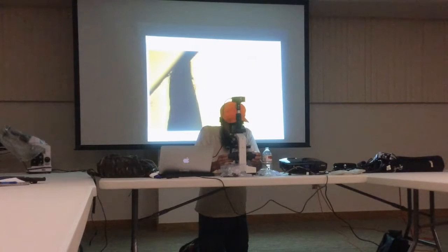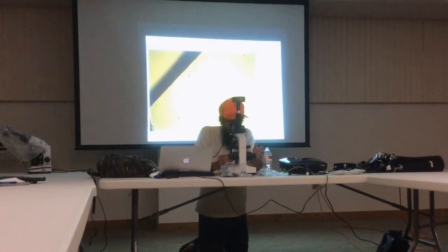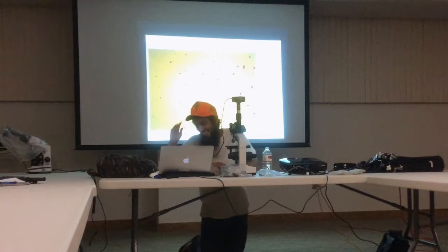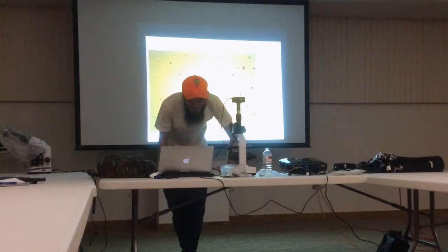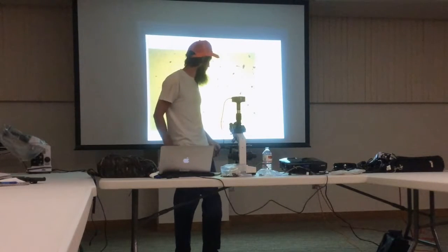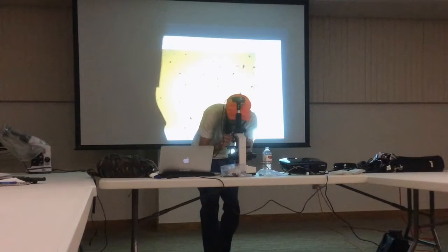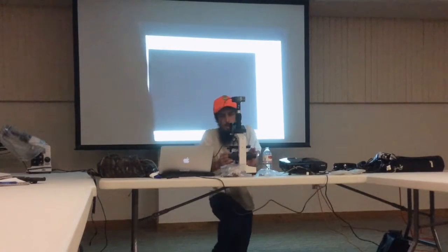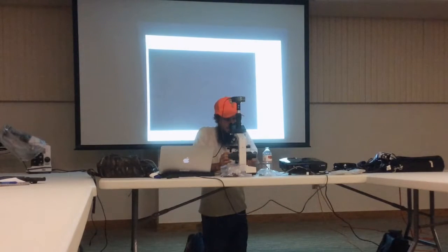Okay, and so I did not see any nematodes. I scrolled the whole thing. I was hoping to find one, because it's always nice to see and share. That might be a beard hair. They're everywhere. Okay, so I scrolled through it at 40 times and didn't find any nematodes. So I'm just gonna zoom into 400 times, and 400 times is what I'm using to look for my beneficial fungus.